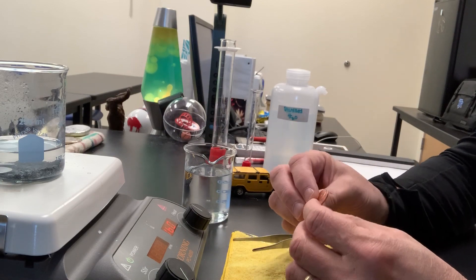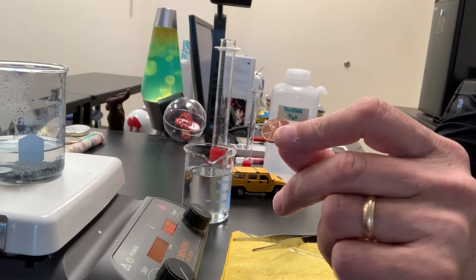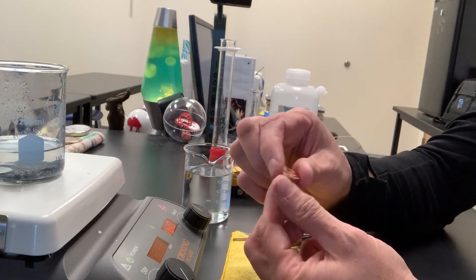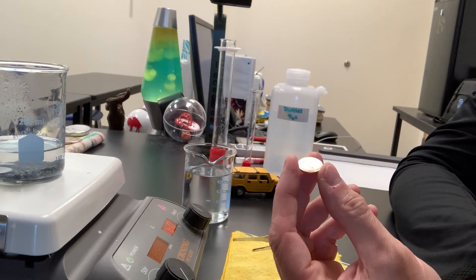What I've decided to use is a penny, and of course a penny is coated with copper. The copper on the surface of the penny is elemental, it's pure.